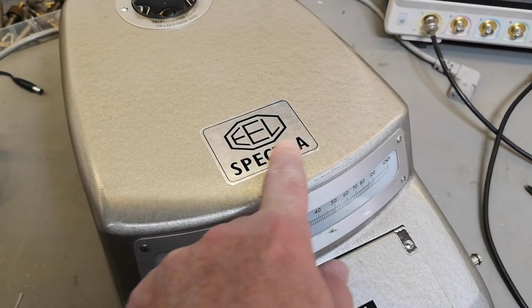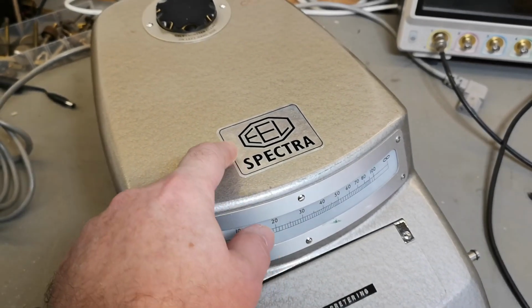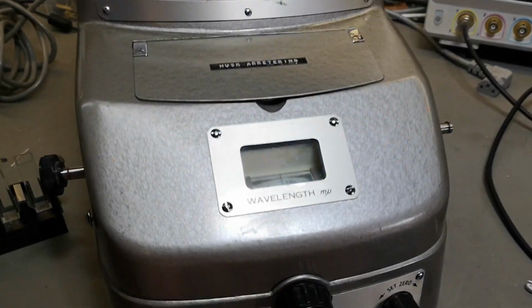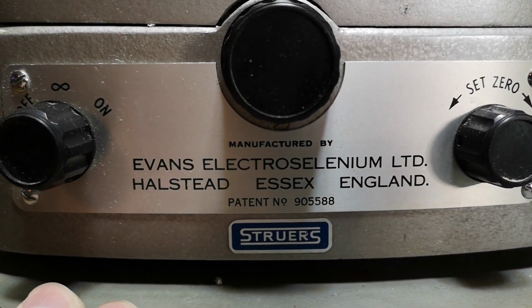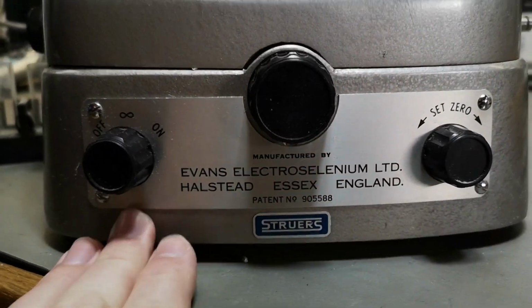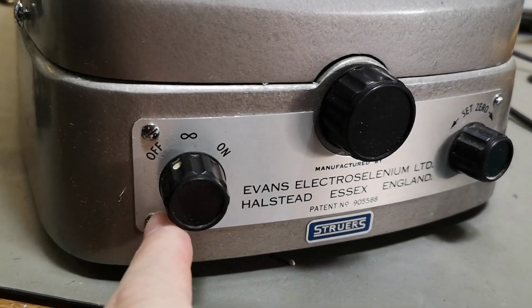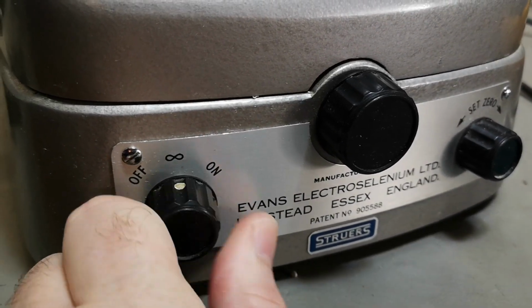Spectra. So that is a wavelength spectral analyzer. And it is from EEL. So I believe that means Evans Electroselenium Ltd. from England. So it's probably quite old. Very special design. So this is of course power on off, but look at that.